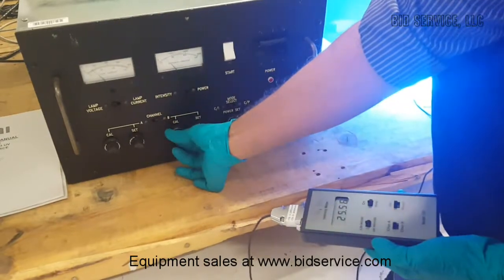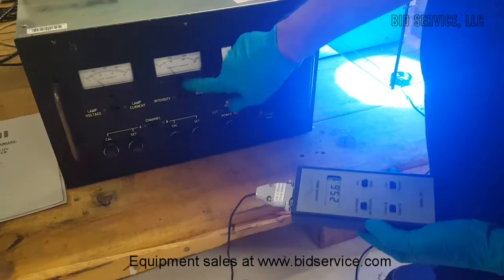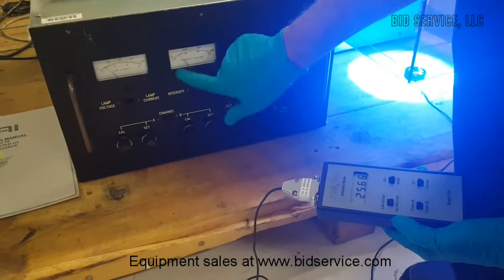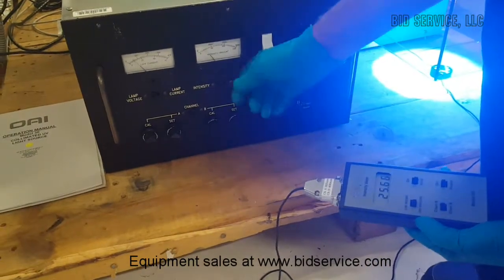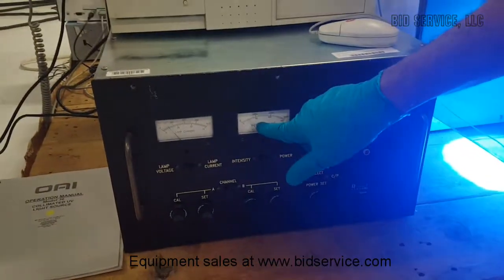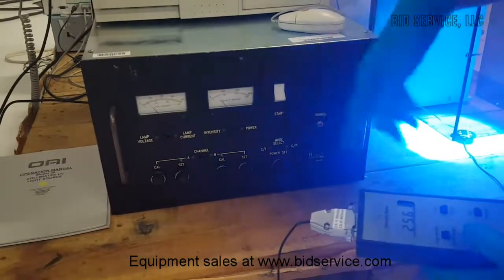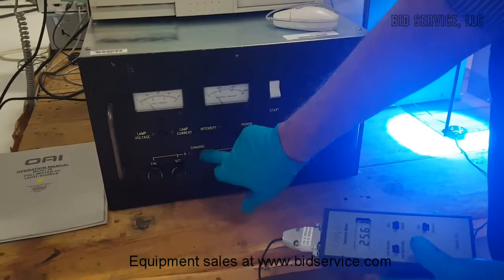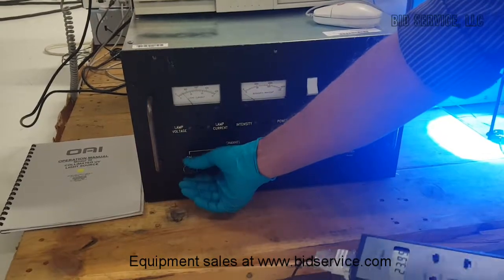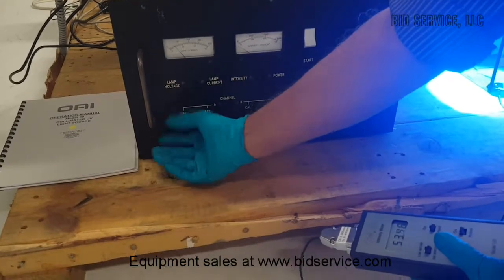the meter, to match this meter here, which indicates either intensity or power. Right now it is intensity that it is showing here, and then we have to match it. This is about 25 milliwatt, and the analog meter here is also indicating 25 milliwatt per centimeter square, and that's at 365 nanometers. So if you choose channel A, then that will be another. So this needs calibration as well.